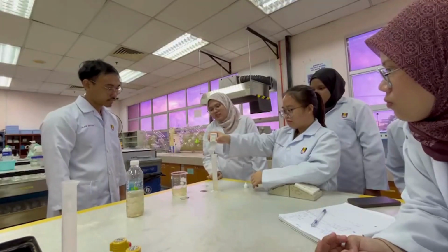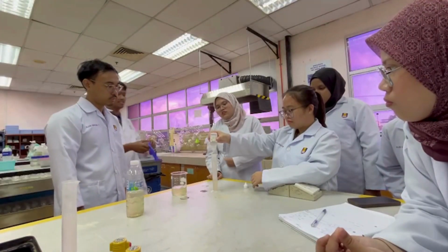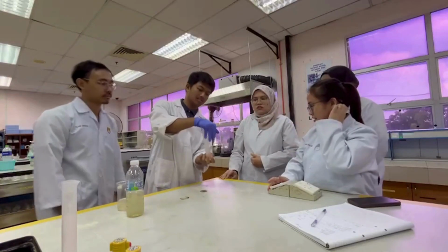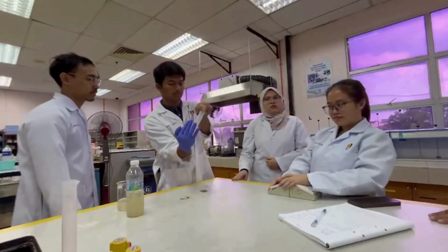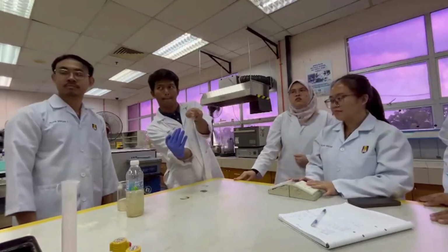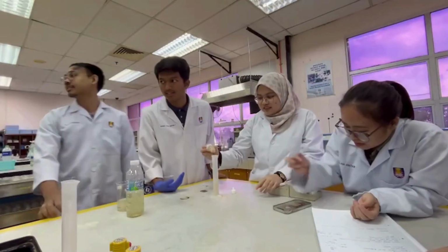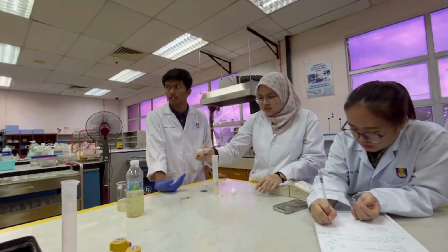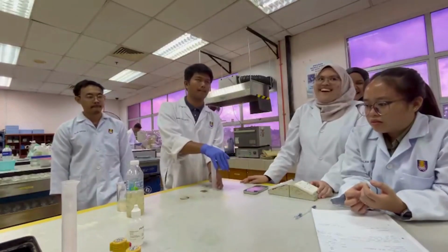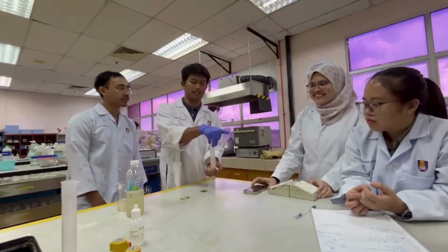3 drops of mineral stabilizer were added to both the sample and the blank, and each was inverted several times to mix. After that, 3 drops of polyvinyl alcohol dispersing agent were added to both the sample and the blank, followed by gentle inversion to mix.